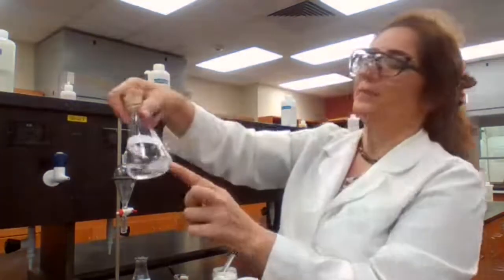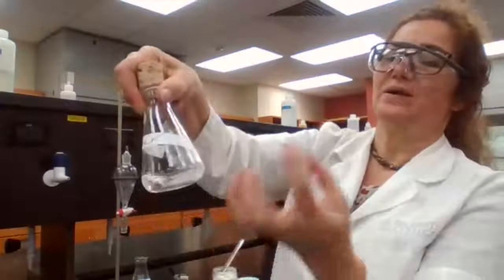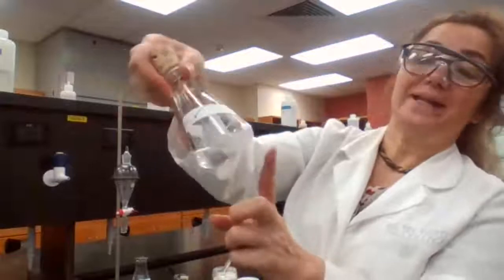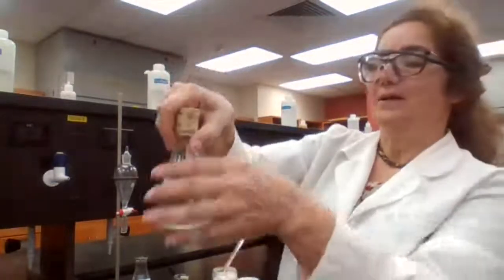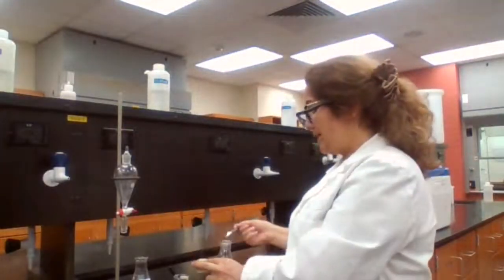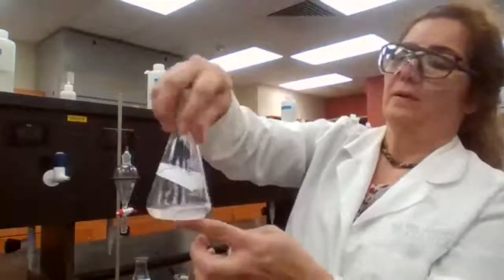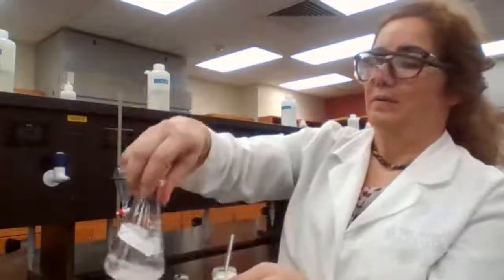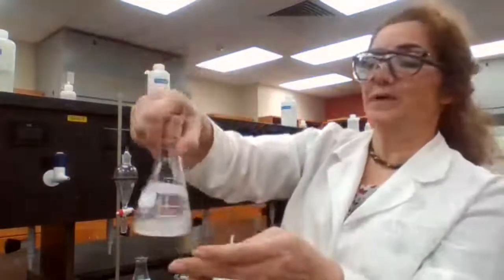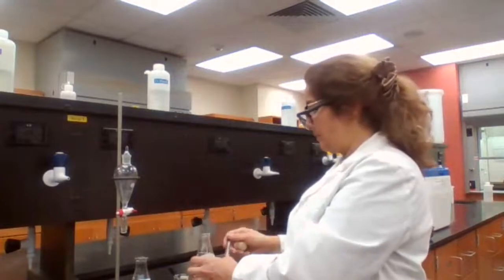what's going to happen? The sodium sulfate that I have is going to turn into a paste, it's going to stay together, it clumps up, it's not moving around. That means that I had some water mixed with the ether layer. So I need to add more. At this point, I'm adding another half a spatula. Okay. If it clumps up, that means it still is moist. If it starts moving, it means it's enough. We can add some more.